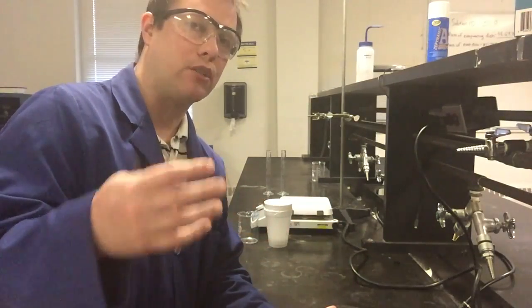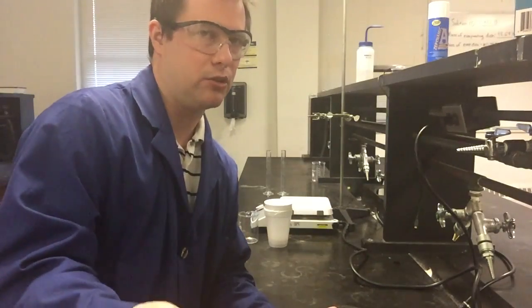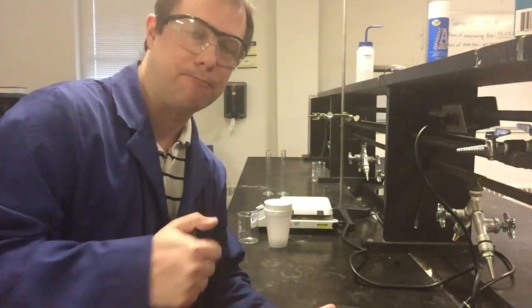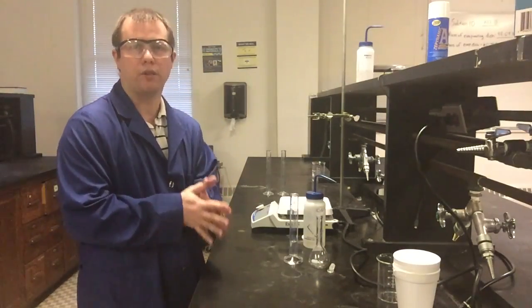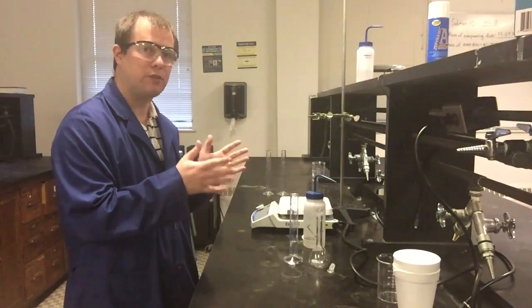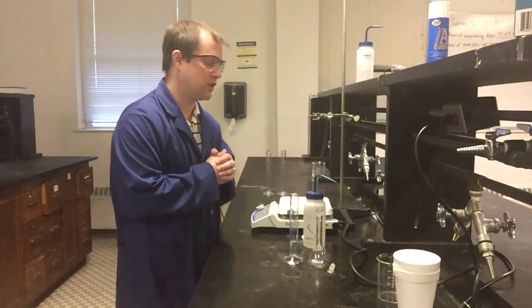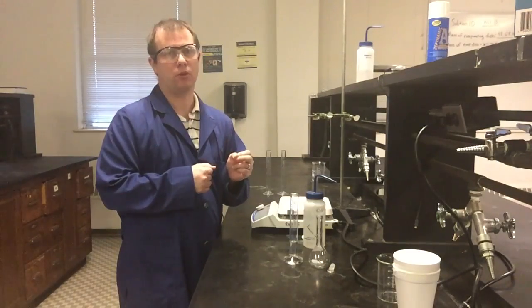Now we're going to move into part 2 of the experiment where we actually do the acid-base reaction. But before we do that, we do have a dilution to do for our acid solution before we use it. All right, so to make our acid solution, we want 100 milliliters of a 1 molar HCl solution. That way we'll have enough to do 2 trials that'll use 50 milliliters each of that HCl solution at 1 molar. The stock solution you're given usually for this lab is 6 molar HCl.